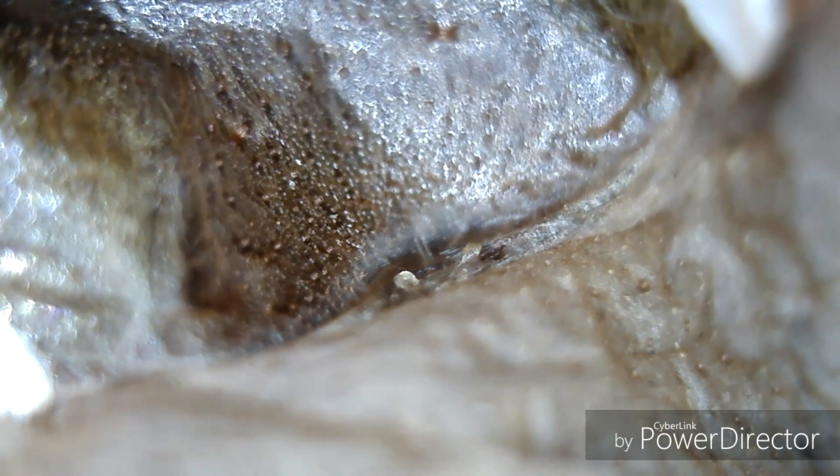This is actually the microscope zoomed all the way out — you can tell by my finger how big the sling is. You can't really see too clear; it's not really made for that type of stuff. But anyway, you can tell how big the sling is — no bullcrap, no tricks, none of that. Let's back it up just a little bit, and voila, that's what we were looking at. Let me get it centered — there we go.